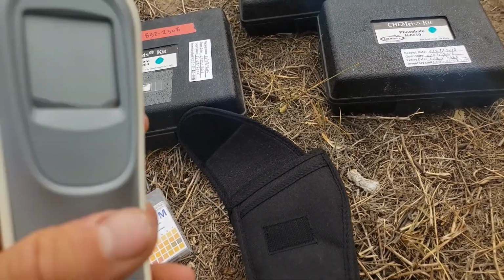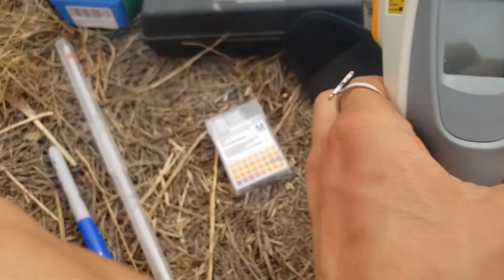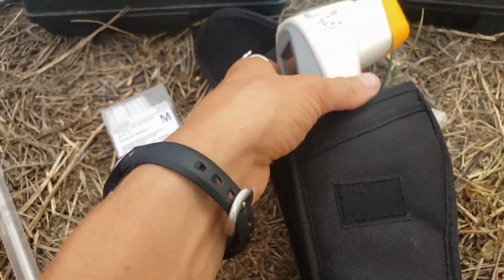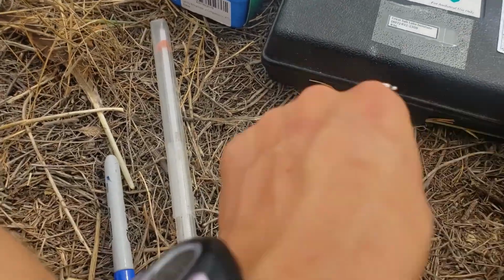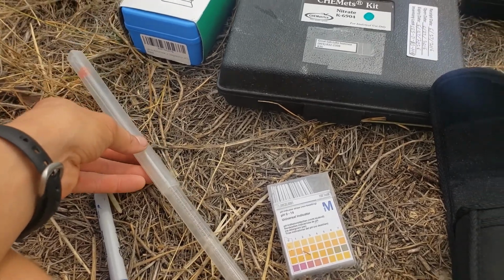But let's see, I hope mine is, oop, we maybe need more batteries, which is awesome because we have the mercury thermometer instead, which sometimes gives better results in my opinion. Okay, so let's go ahead and measure the temperature. Let's go through our tools first.